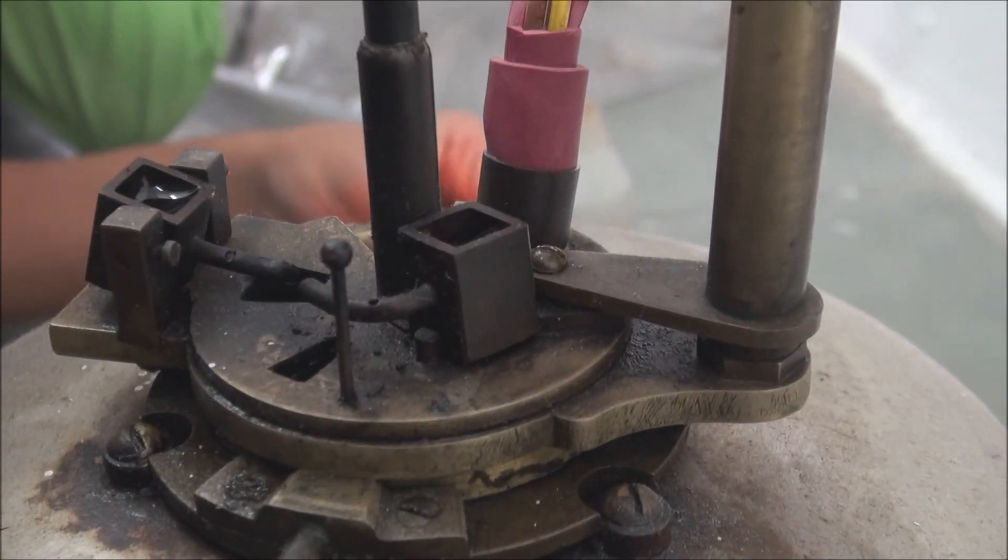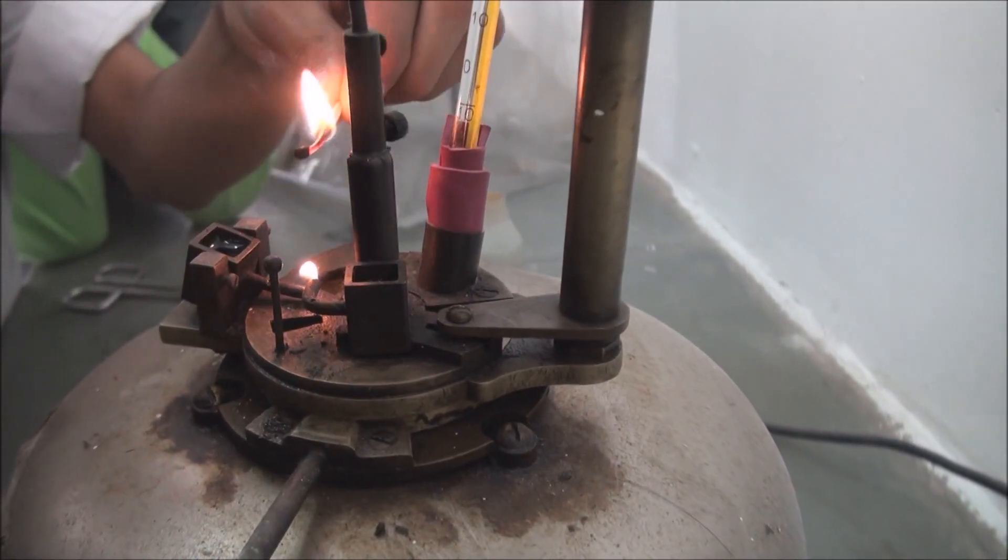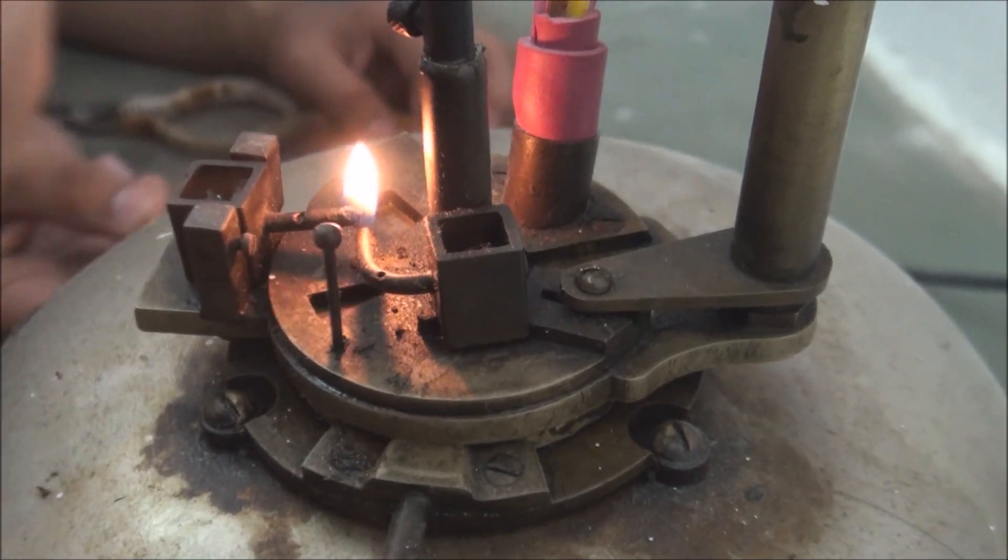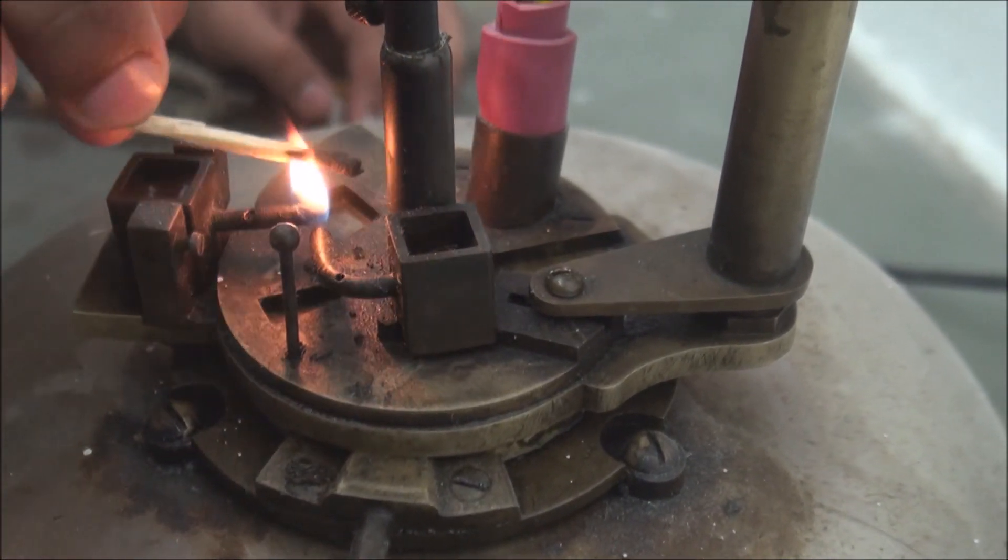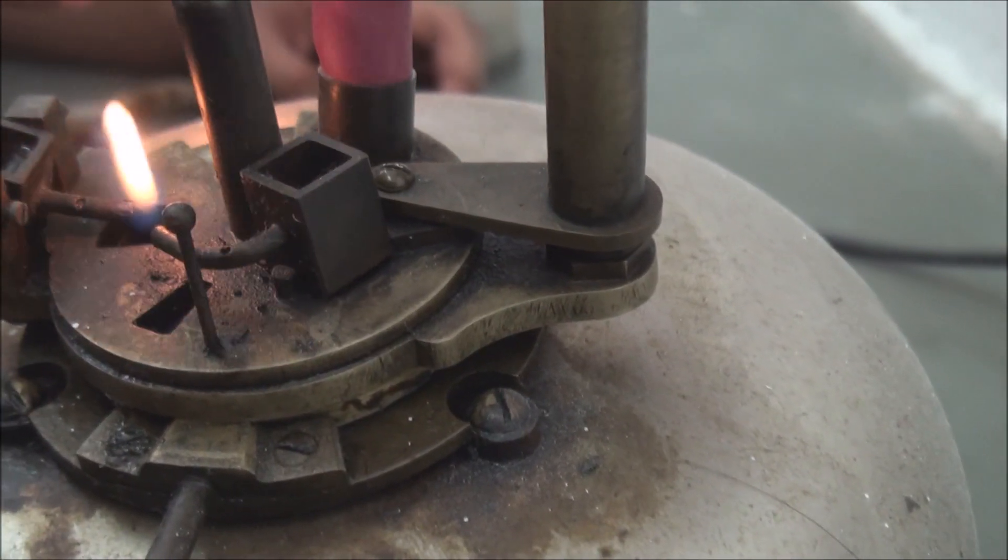Keep in mind that for the fire point, the fire should last at least 5 seconds. For this temperature, we have achieved fire point.